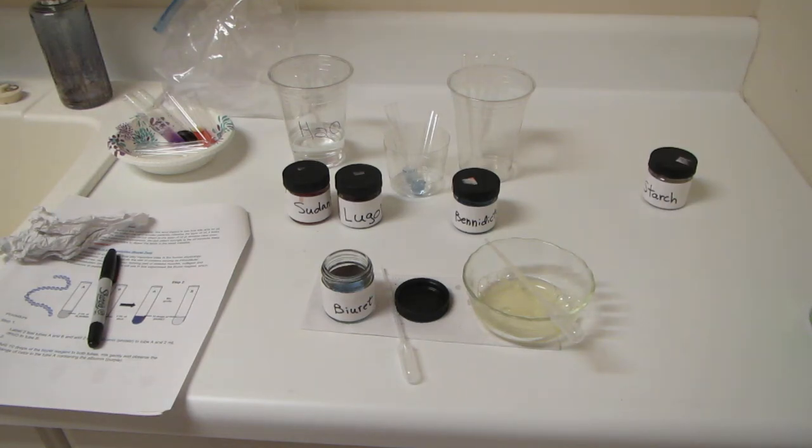Hey everybody, welcome back to Digestive Chemistry. We're going to take a look at how we use Biuret Solution to identify proteins.